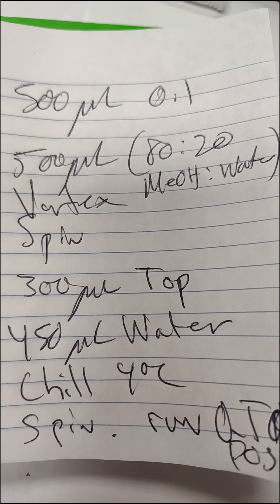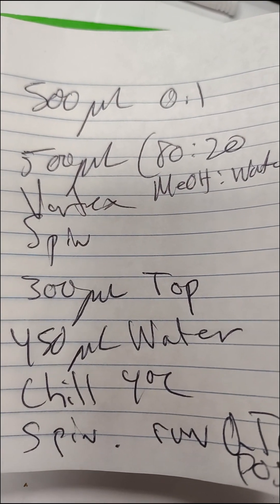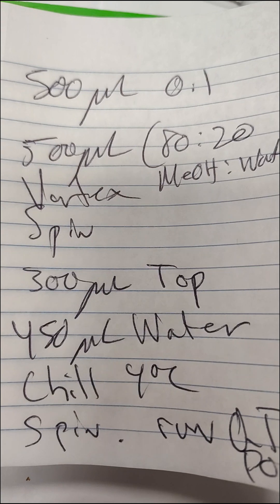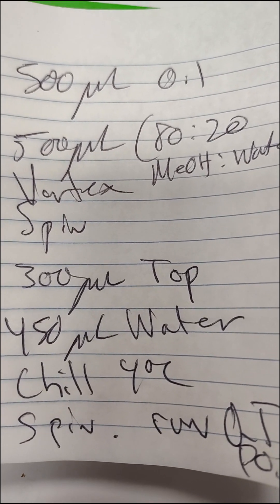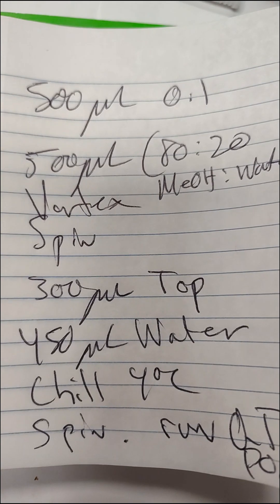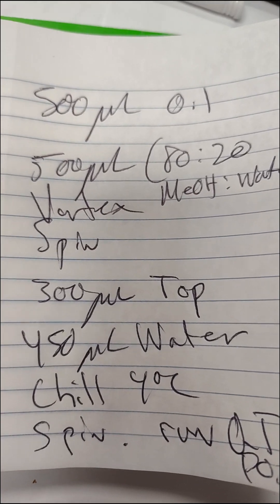So I took and scratched down the protocol here. We're doing 500 microliters of oil, 500 microliters of 80-20 methanol water, vortex it for extraction, spin it out, pull 300 microliters at the top.